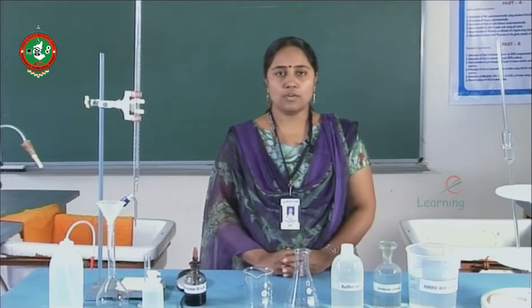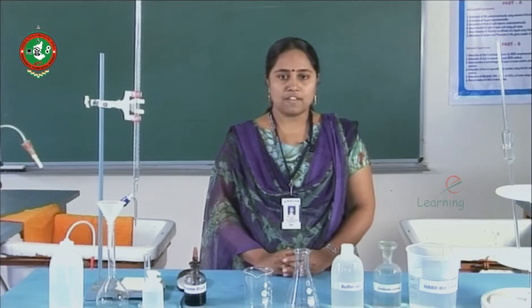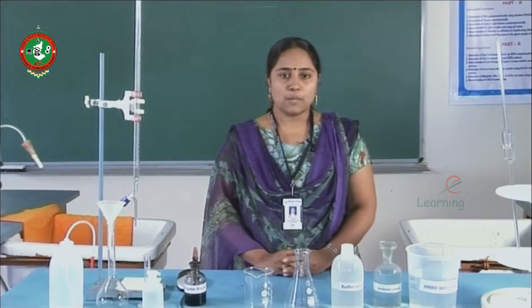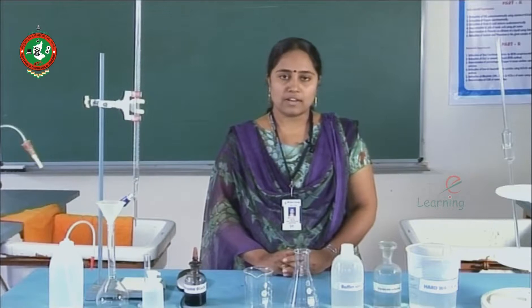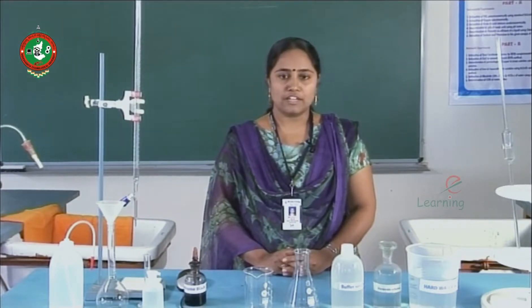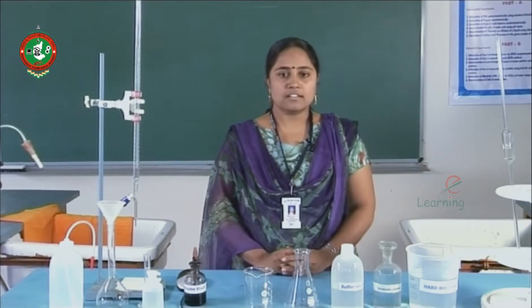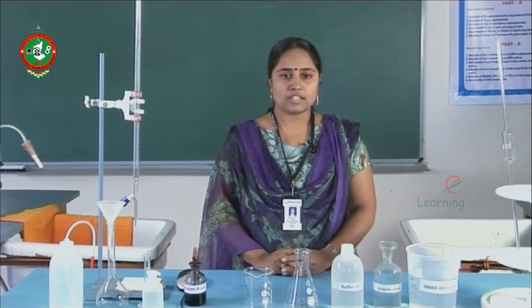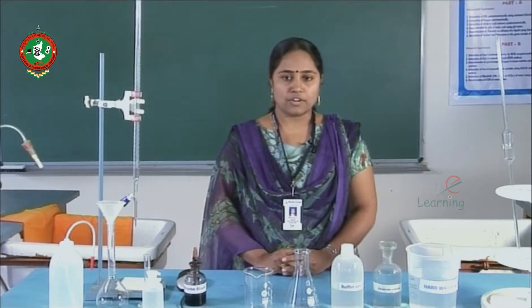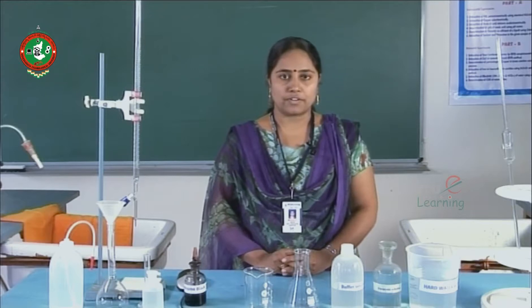Let us see how the conical flask has to be washed. Wash the conical flask thoroughly with tap water. Rinse it once with a small quantity of deionized water. Do not rinse it with any of the solutions. After every trial, reject the contents of the conical flask to the sink and wash thoroughly with tap water, then rinse with a small quantity of deionized water.